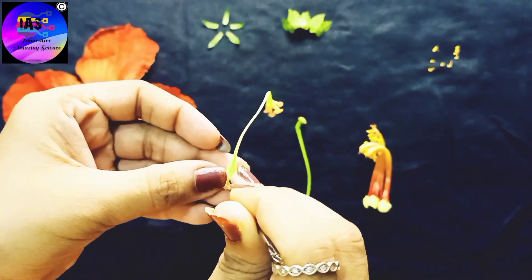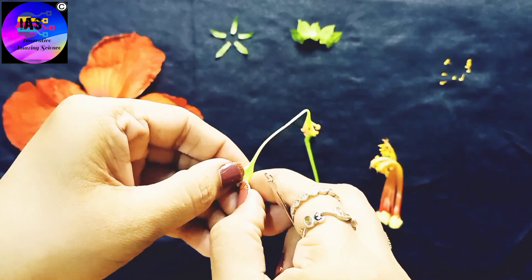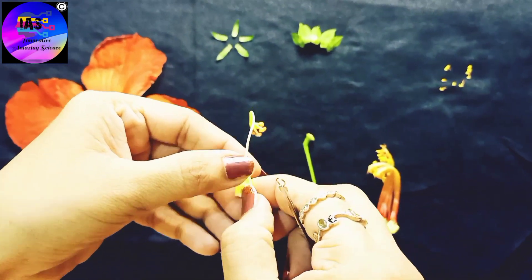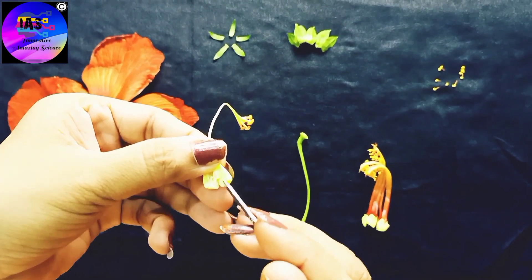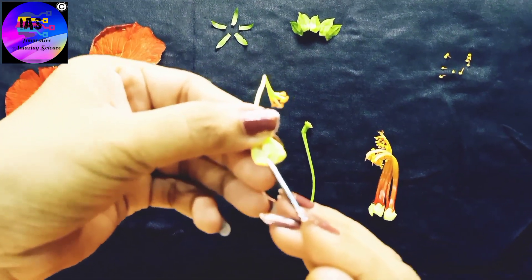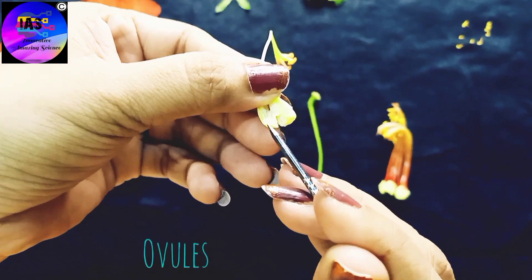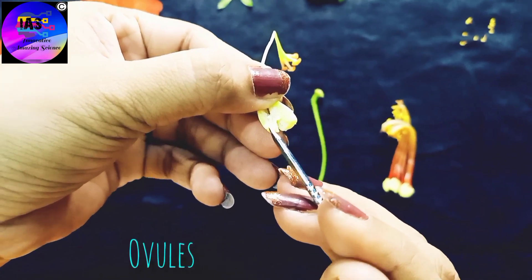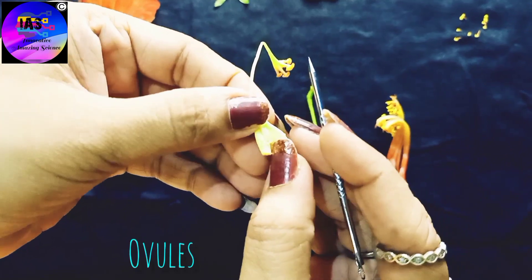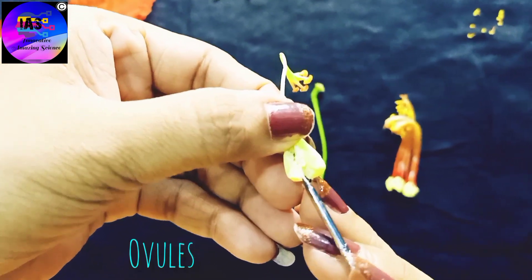I'll try to prick the ovary with my needle and let's see what is inside. Slowly you have to pierce it. I can see the ovules, which are present inside the ovary. It is looking awesome — just observe it.